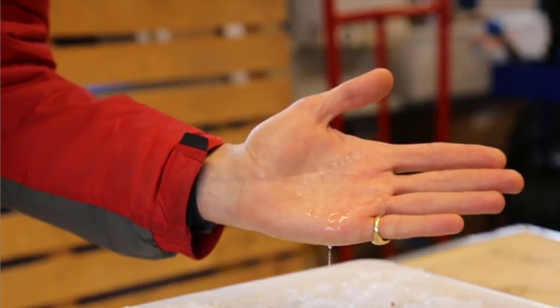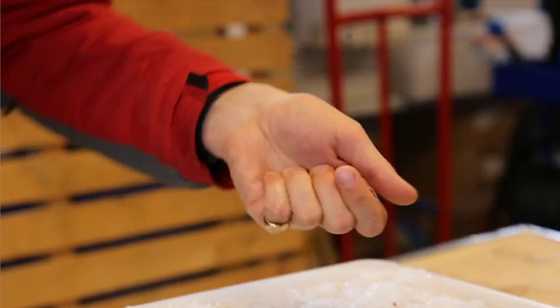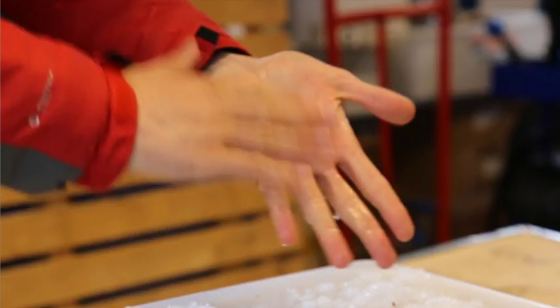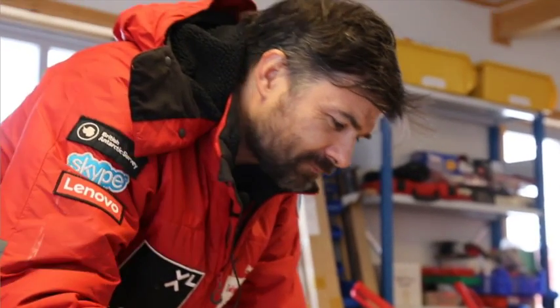So we can see that there's my second plastic sample. So I had 14 or 15? 14. Well, that's great. No plastics in this bit of ice. That's good news all round. And little bits of, who knew that little bits of pink peppercorns could be so sticky.